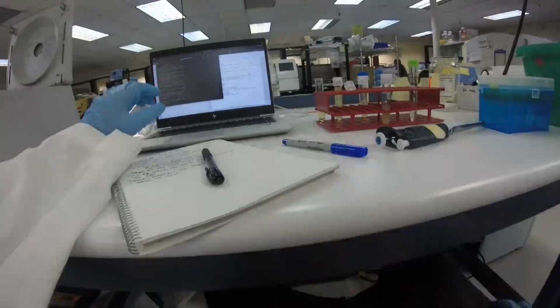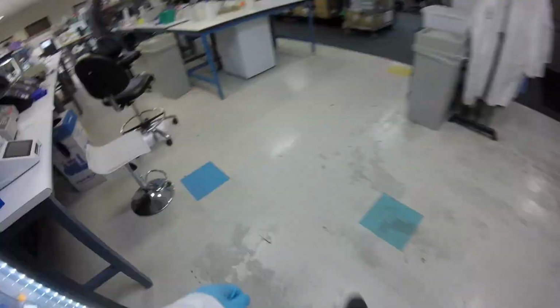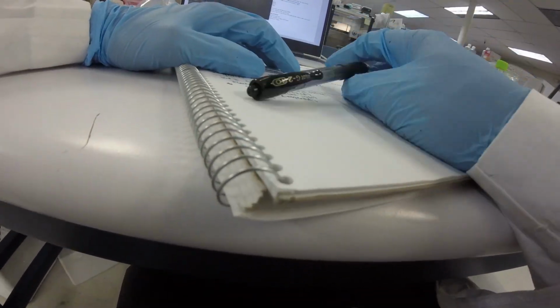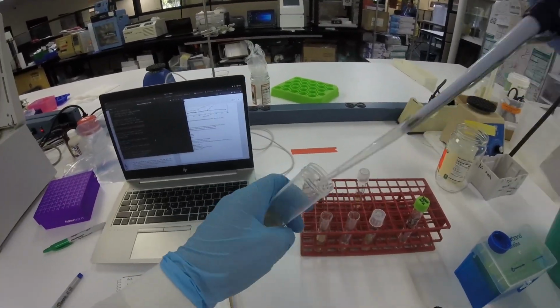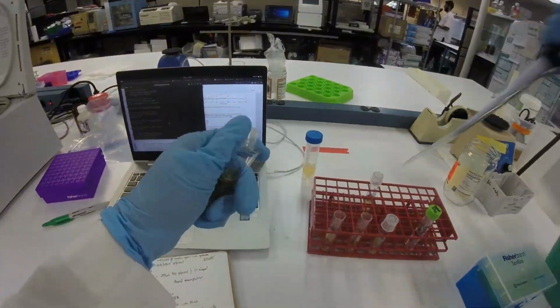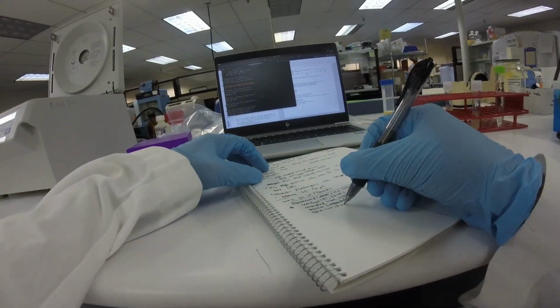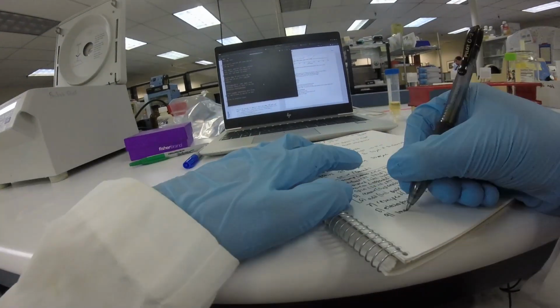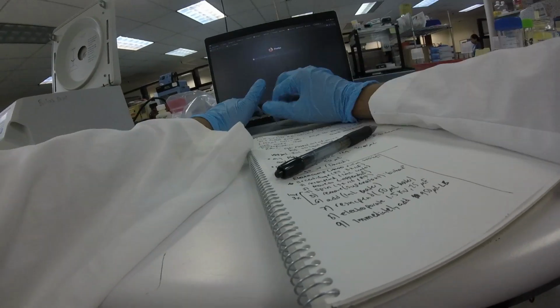And Gemini, because ChatGPT refuses to give me any guidance on labs, gave me some improvements that I should use instead of just water. I should use 10% cold glycerol because it reduces the osmotic pressure against the cells. So basically, this is just me trying to understand a new protocol. Okay, so I think I'm starting the incubation, but I think those are contaminated because I was seeing some weird stuff. But yeah, this is a pretty chill day.